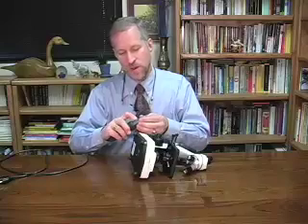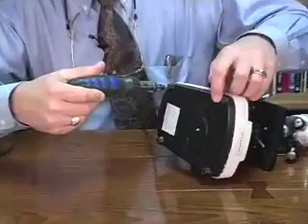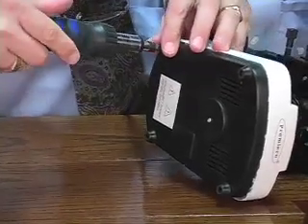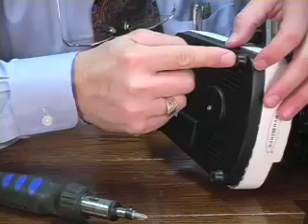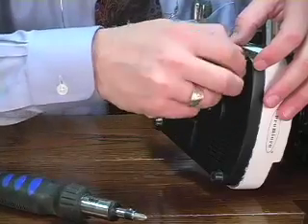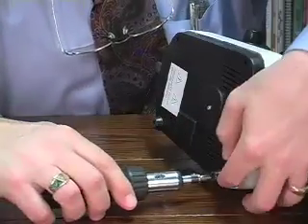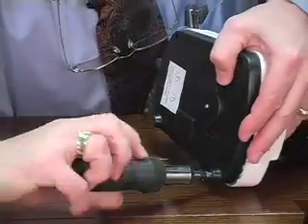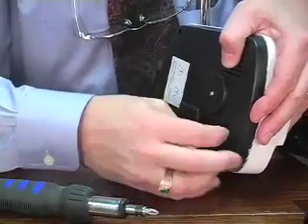Well, it's pretty straightforward. You merely have to unscrew all 4 screws from the feet. So I'm going to do that now. Actually, it's easy. Once you've begun unscrewing the base, the foot, you can actually finish the job with your fingers on the rubber of the base itself. So you're going to want to start it here, but then finish the unscrewing with your fingers.